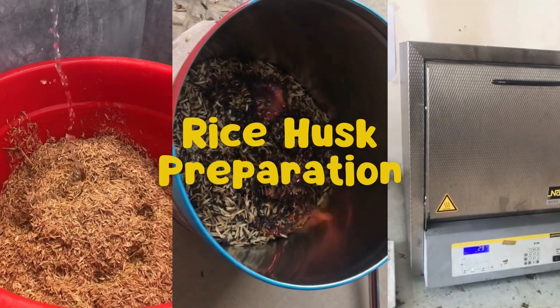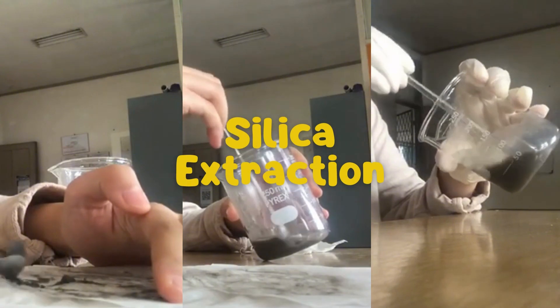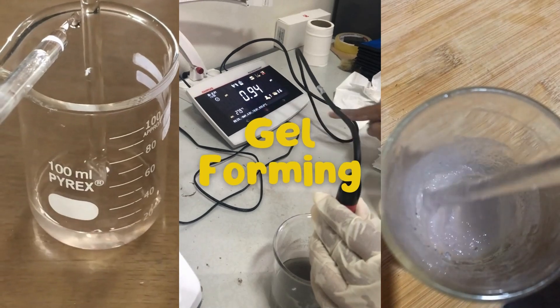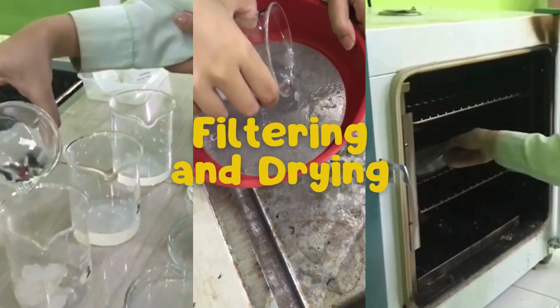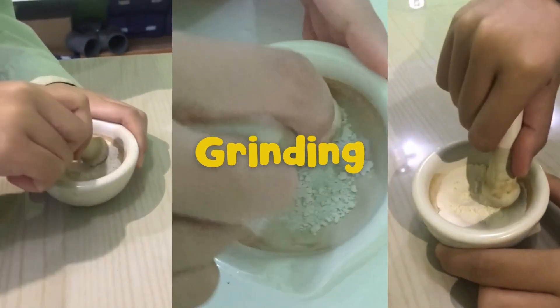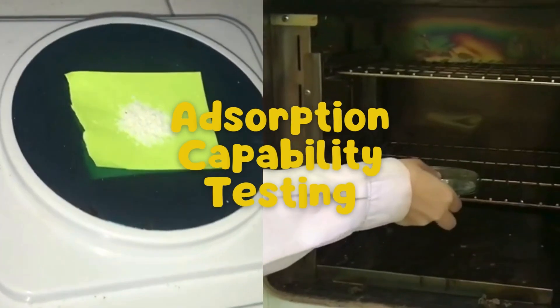This Sol-gel method involves the following steps: rice husk preparation, silica extraction, gel forming, filtering and drying, grinding, and adsorption capability testing.